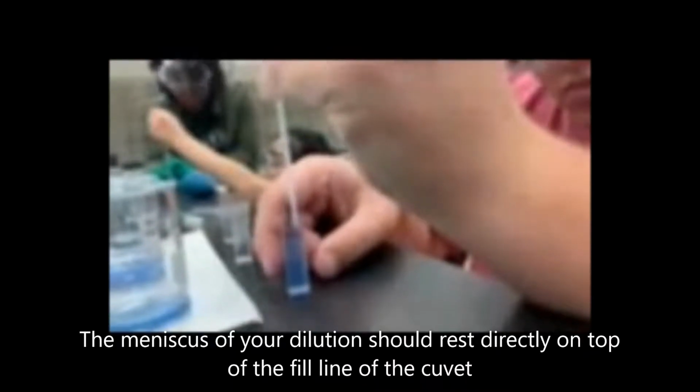To begin this lab, we will use transfer pipettes to transfer all of our prepared stock solutions to their own cuvettes. As you can see, my hands are very steady, but you want to make sure that the meniscus of your dilution rests directly on top of the fill line of the cuvette.